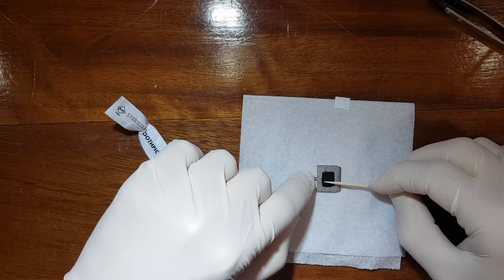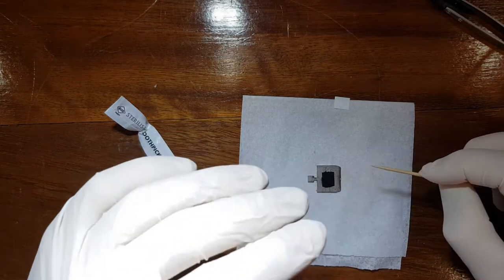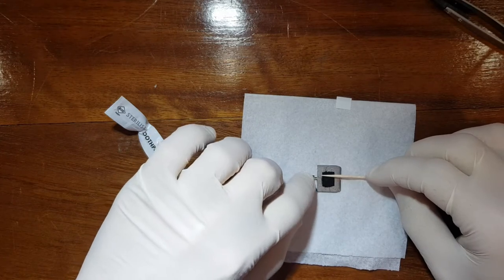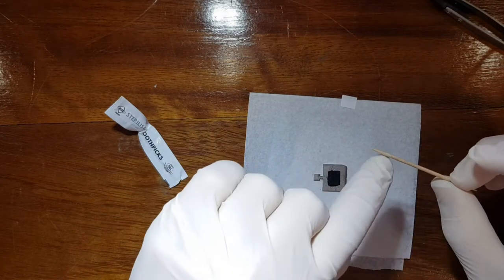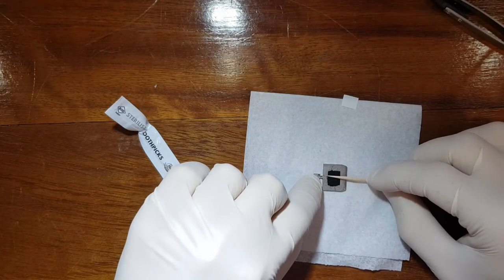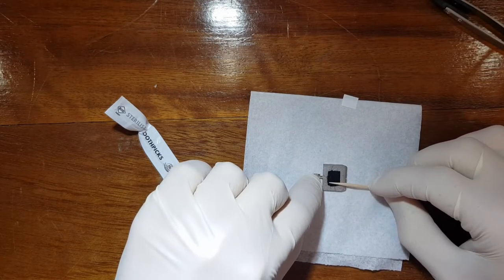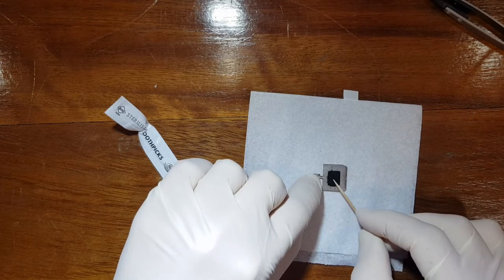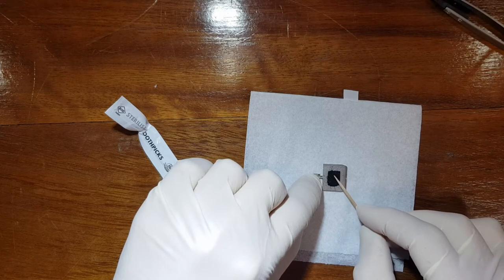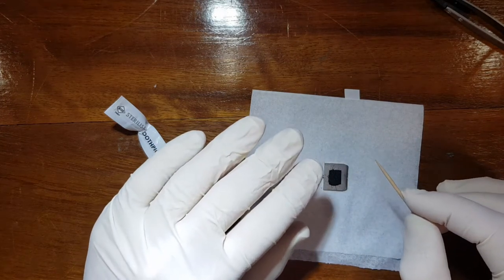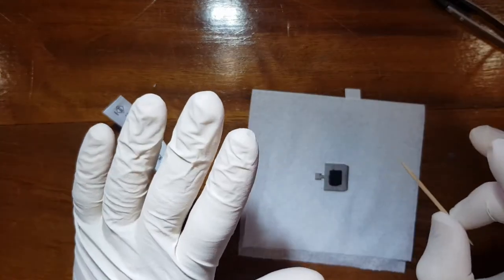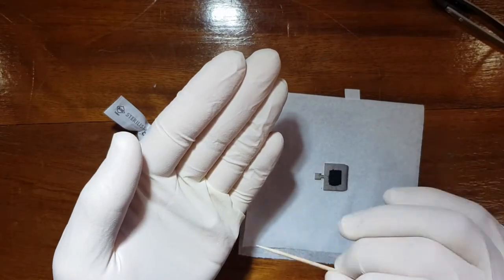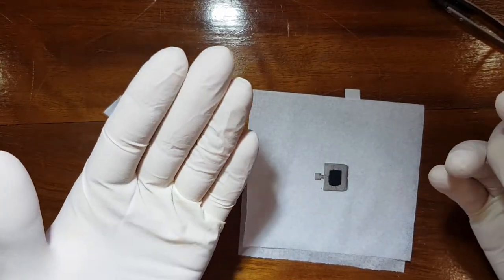Powder on the sample holder. Now sometimes the sample could be quite rough and brittle, so then you can use the toothpick, you can use the toothpick like this, you just crush up the sample so you have an even distribution. Now this obviously takes a bit of care and practice. Now I do not particularly care too much for touching the toothpick because this is going to be a one sample and I'm not going to reuse these gloves to mount another sample.